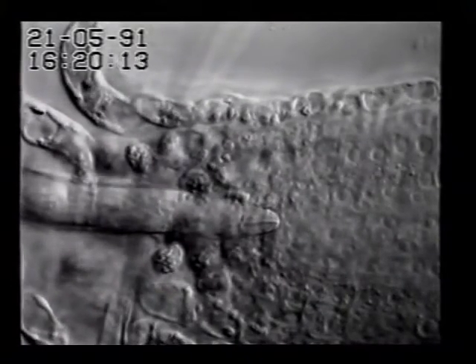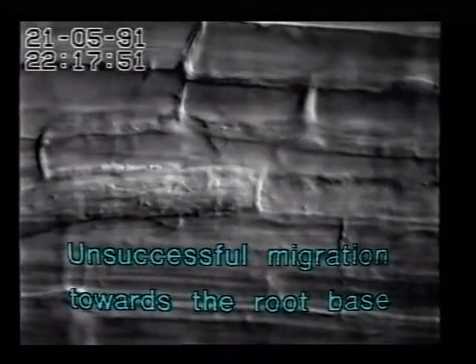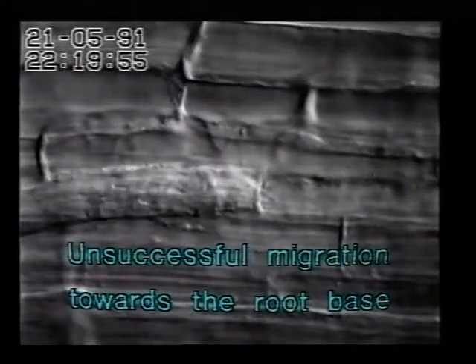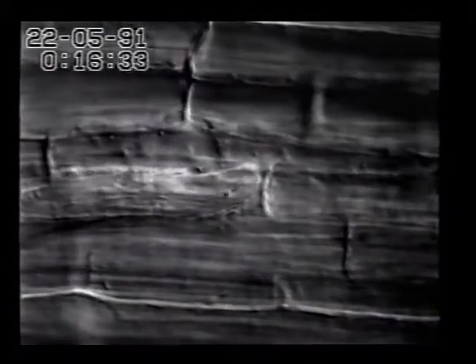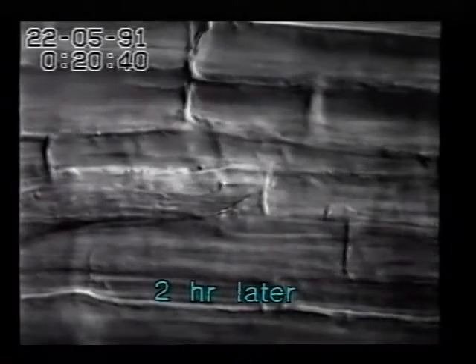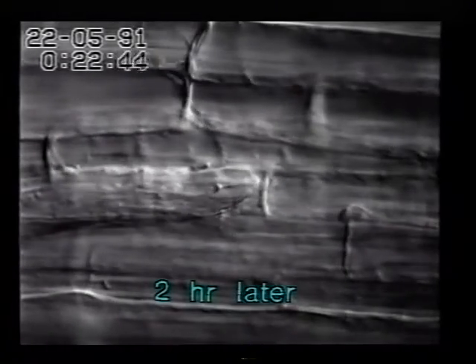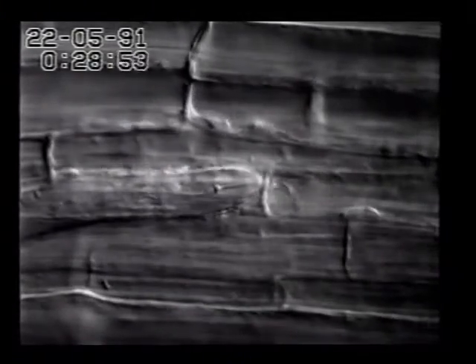The second example shows a juvenile which has not oriented itself towards the root tip, but in the opposite direction, towards the root's base. In this direction, the nematode becomes trapped by the thick cell walls, which impose an unsurmountable obstacle. Hours later, this juvenile is still trying to perforate this cell wall, however, without success.